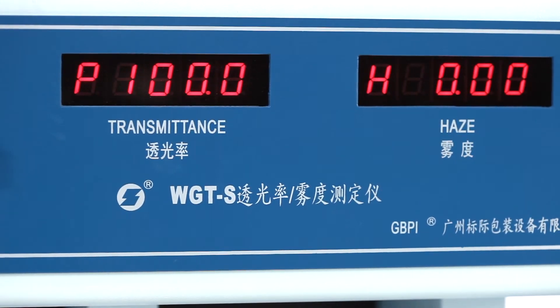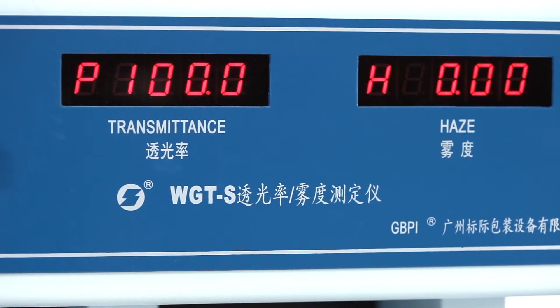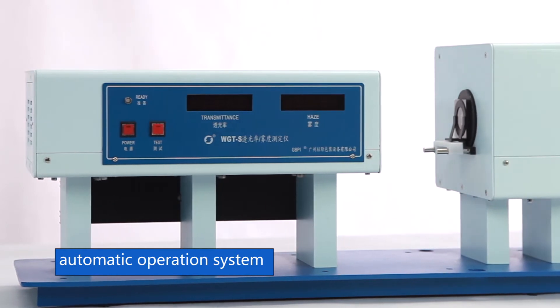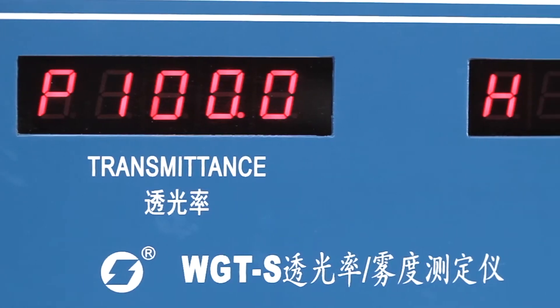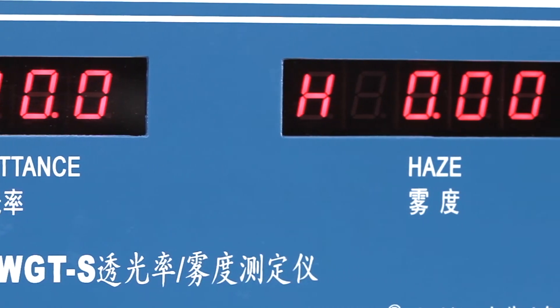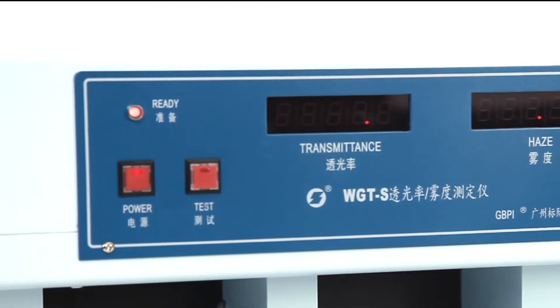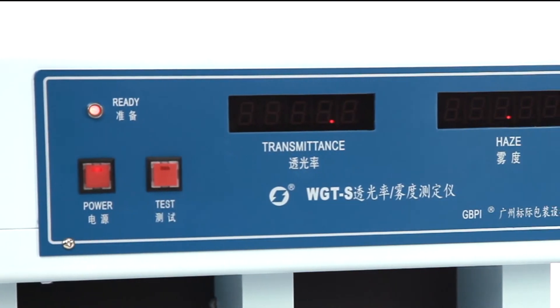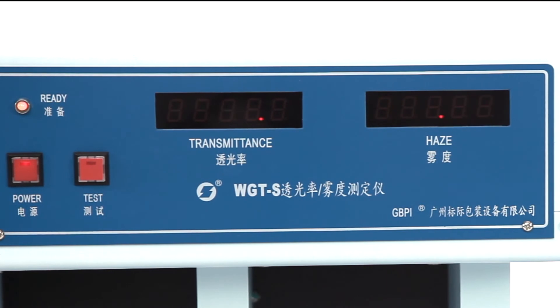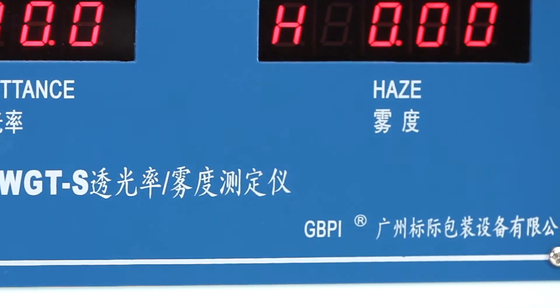It can display average values and operates as an automatic system, automatically switching between light transmittance and haze degree testing. All adjustments are automatic, offering high accuracy and ease of use. GBPI — the overall program of packaging and testing technology.